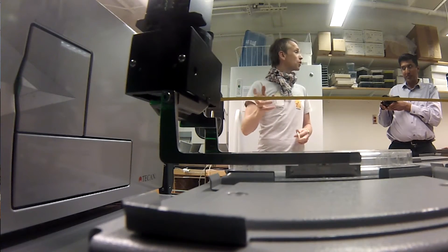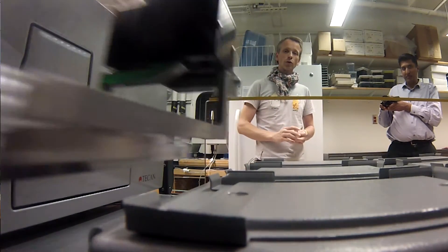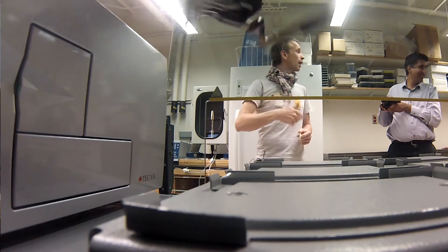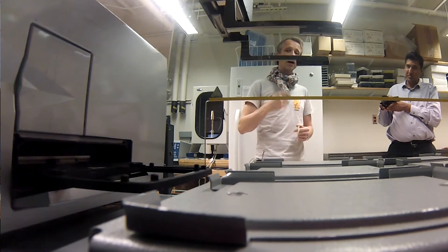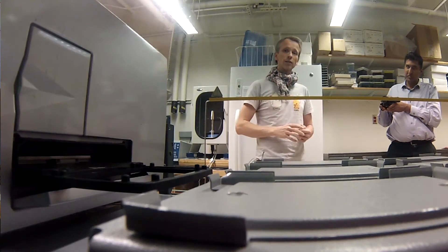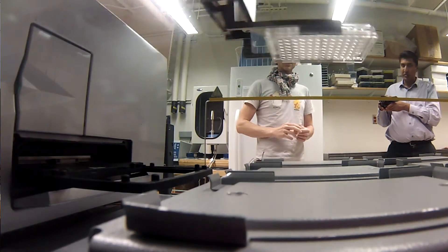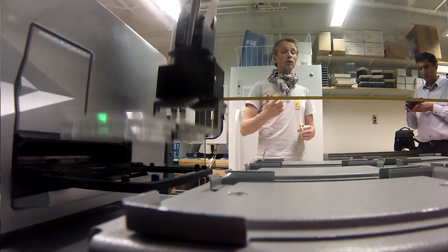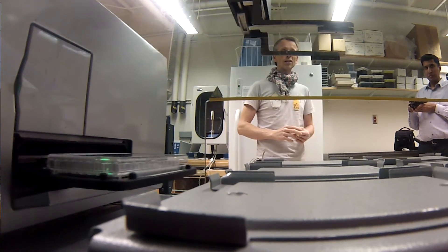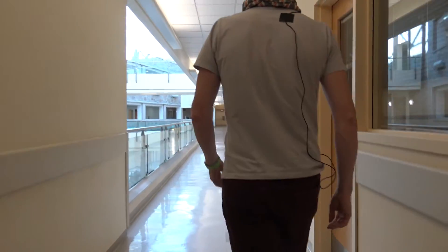The incubator is kept at a certain temperature. The robot can also take those plates out of those incubators — those hotels — and then stick them into a plate reader. The plate reader then takes a measurement to determine how fast the bacteria are growing, whether the drugs that we add to these bacteria are having any effects. We can cycle this through 16 hours, so we don't really have to stay with these bacteria while they're growing.